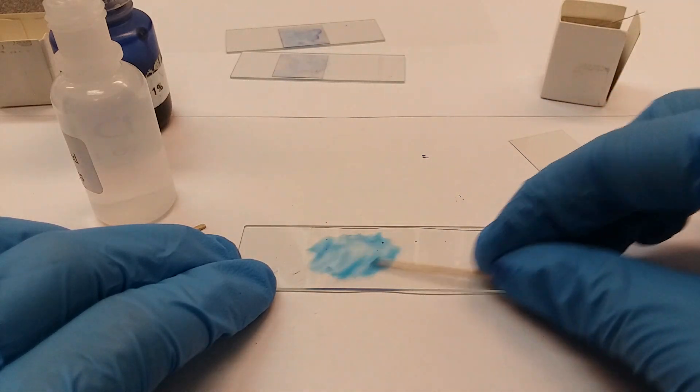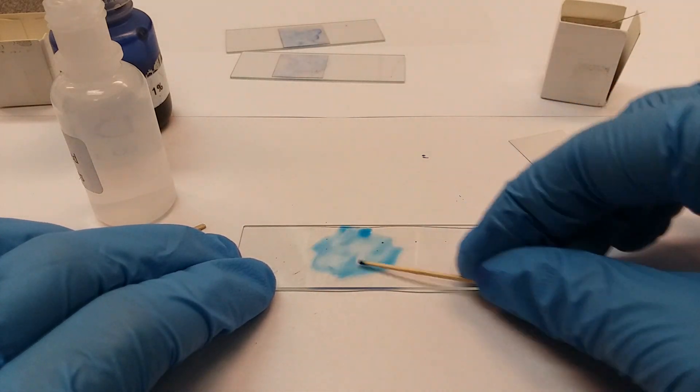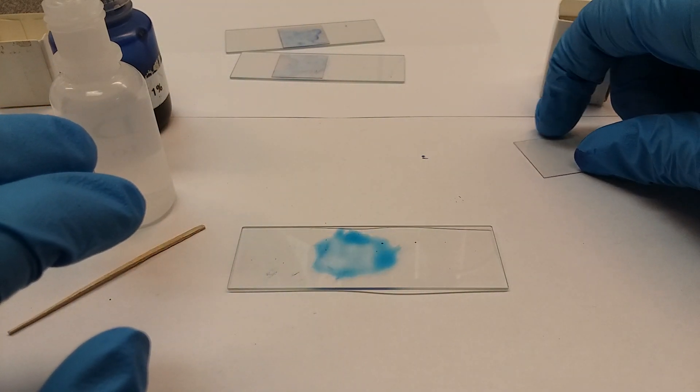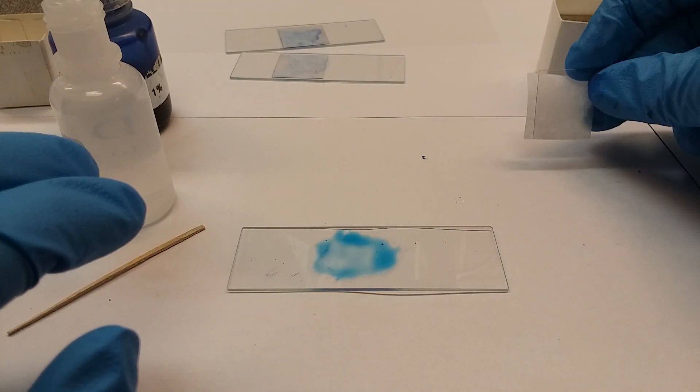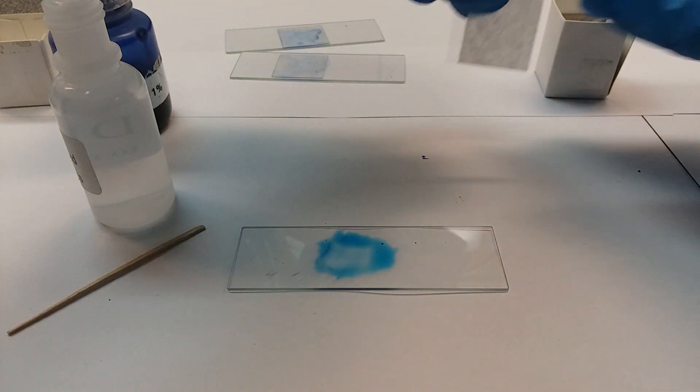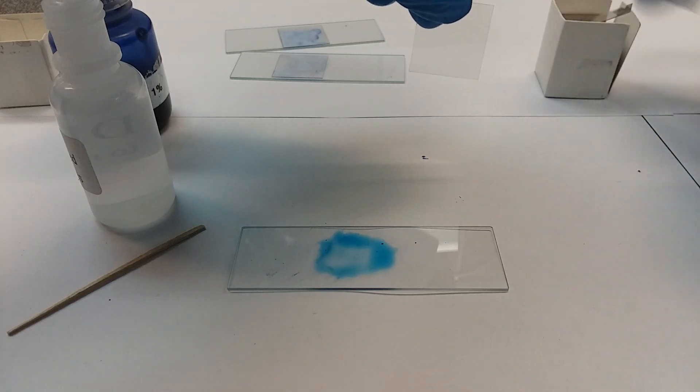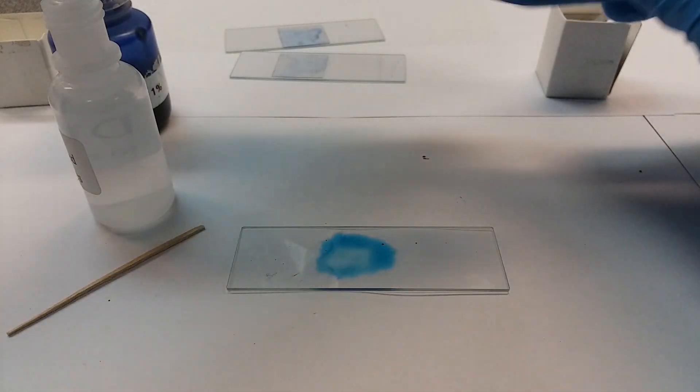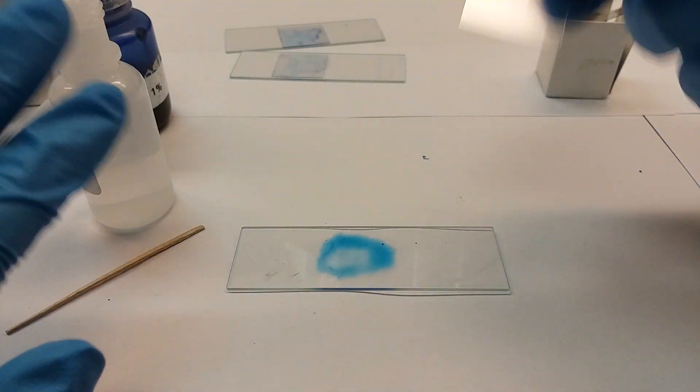This is really wet and we're going to put the cover on there. Now the covers have a little plastic - some may have a plastic divider, most of them are paper. You're going to remove that paper. You just want this clear plastic portion, so we're going to toss that.